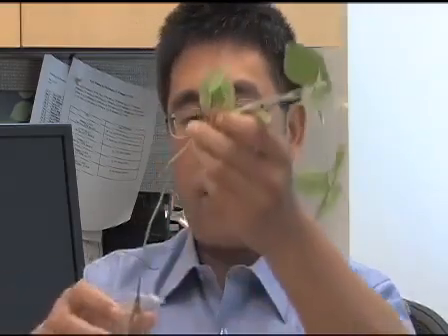Agrobacterium rhizogenes are very similar to Agrobacterium tumefaciens in that they introduce foreign DNA into plants, but the rhizogenes can induce hairy root formation on wild-type tissues, forming composite plants, as this one. So on these composite plants, some of the roots are transgenic while the shoots are still wild type. Therefore, this technology will not produce transgenic seeds.